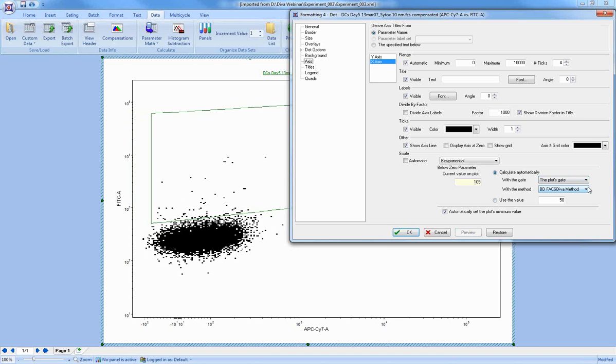I can also calculate it automatically, and there are a couple of ways to do that. You can use whatever the plot is gated on first to get rid of data you don't care about and then calculate it, or calculate it on no gate. But the algorithm operating here is exactly the same as the algorithm operating inside Diva. In general, you will not need to deal with these parameters. You'll just leave it on automatic and it'll pull it from the data file. However, if it's not looking the way you expect, then you can adjust it over here.